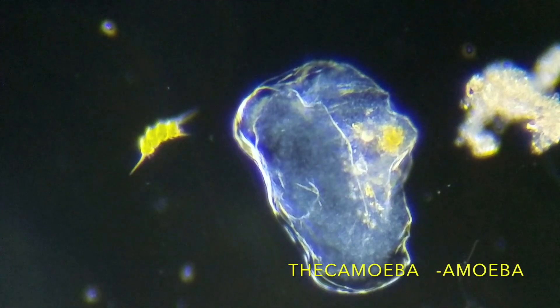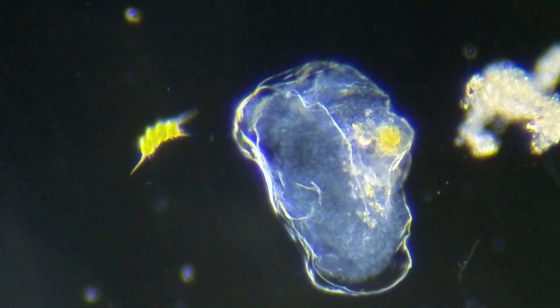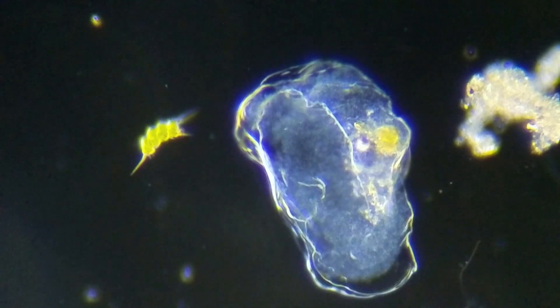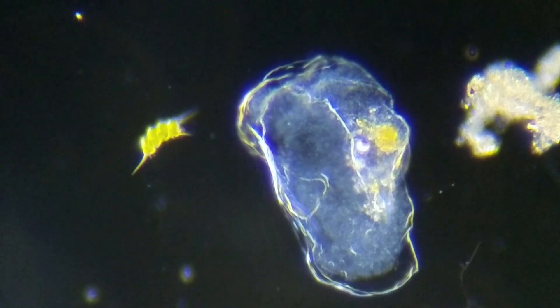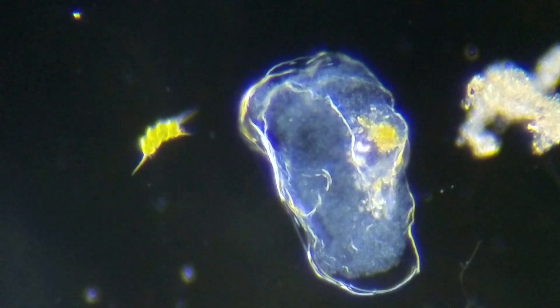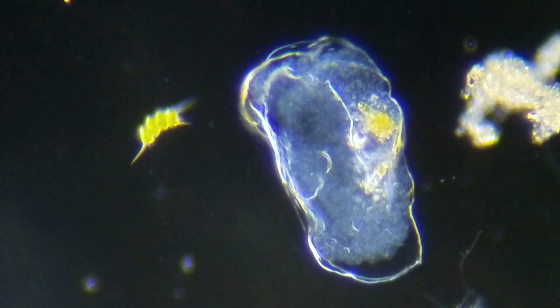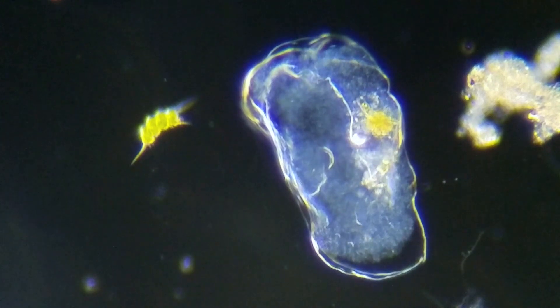This is one of my favorite microorganisms and we're looking at this one at 250 power. Anytime you see an organism that looks like this — it's a blob and it doesn't seem to have any corners to it, it's not round, not triangle, not rectangle, it's just like a blob, a spill — generally that's probably going to be an amoeba.